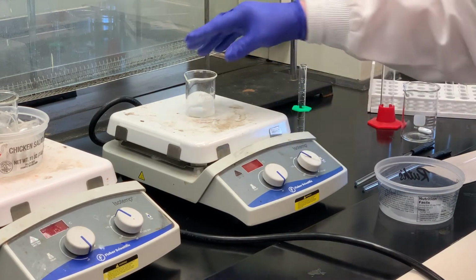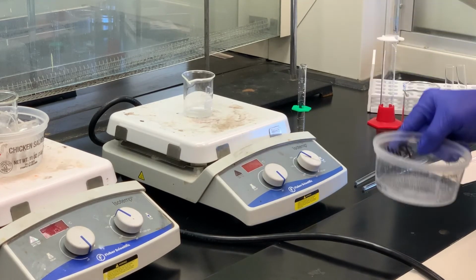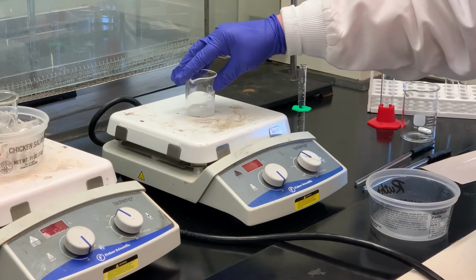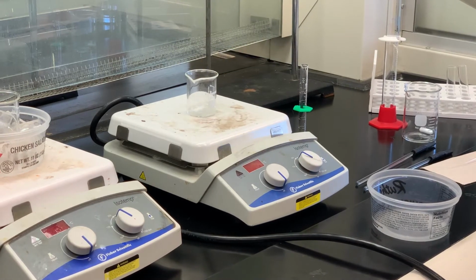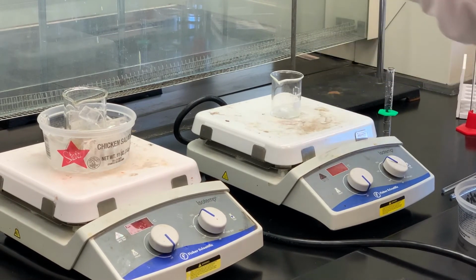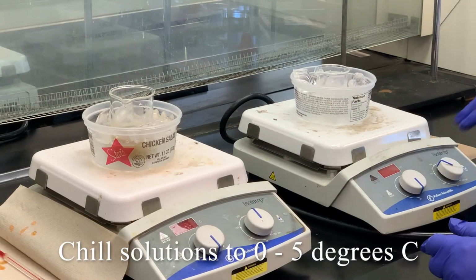Should dissolve pretty easily. And then once that's dissolved, I'm going to put that in an ice bath because that needs to be chilled to 0 to 5 degrees as well. So when we come back, we'll keep a check on the temperature. Once they're both at 0 to 5 degrees, I'll add the sodium nitrite to the para-nitroaniline and the HCl, and then let that stir for about 15 minutes.